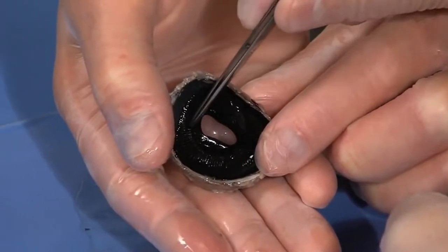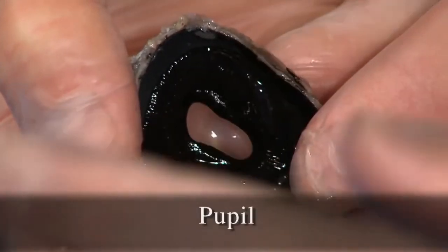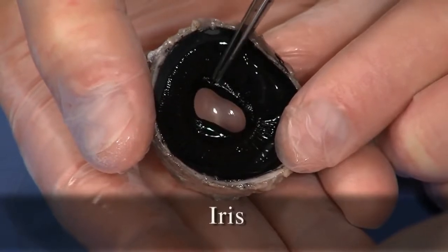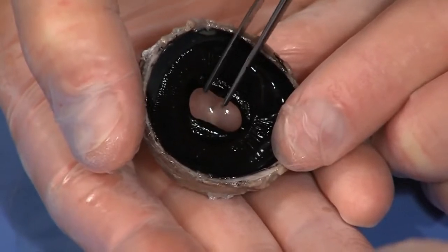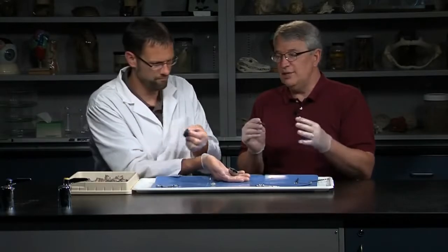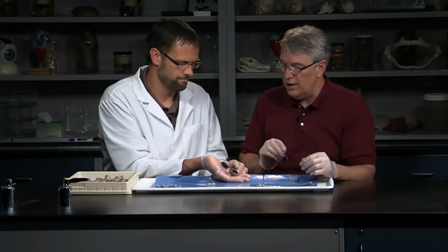From the back, we can see the striations of the ciliary body. Right around this opening — this space is the pupil. The pupil is the space where light enters and comes through the lens. Right around the pupil is the iris. This tissue here is the iris of the cow eye; it's not as colored as it is in people. The iris has muscles that control the diameter of the pupil opening — pupils dilating under low light to let more light in, and contracting under bright light so less light comes in and doesn't damage your eyes.